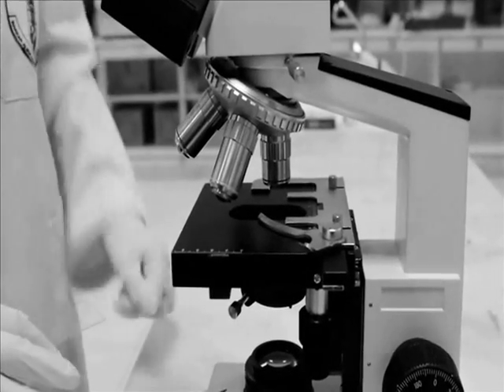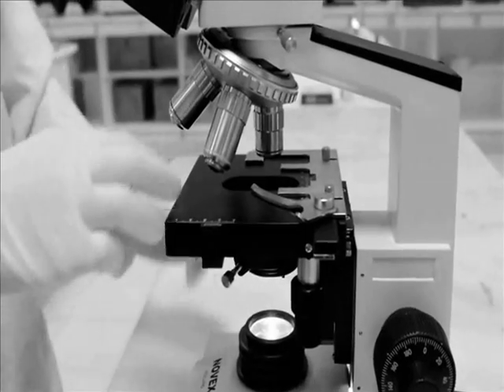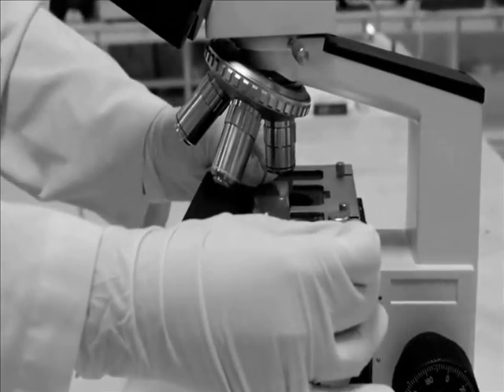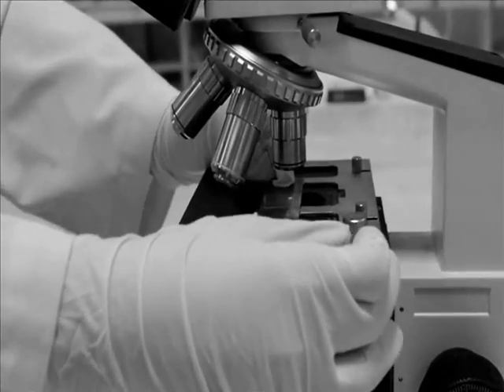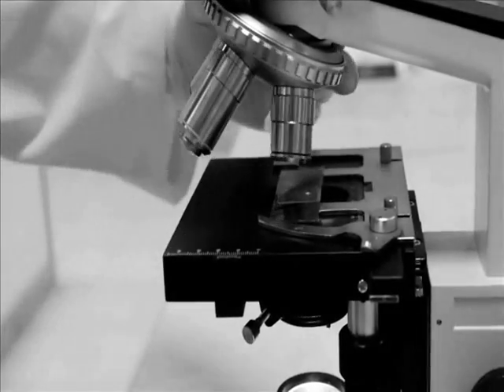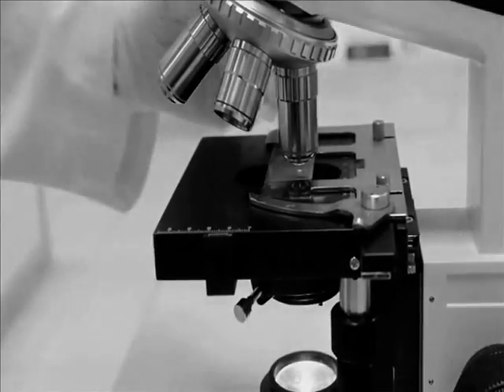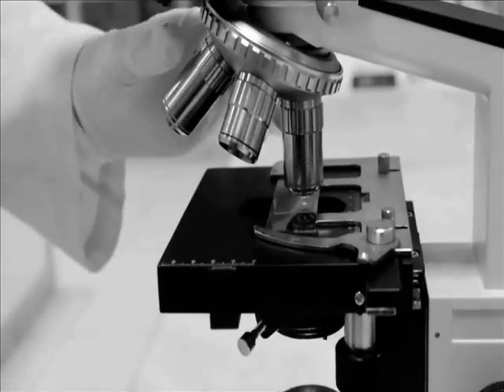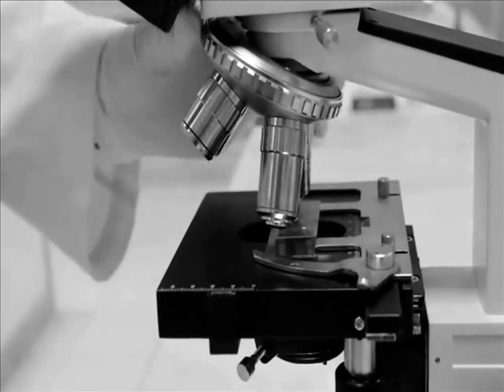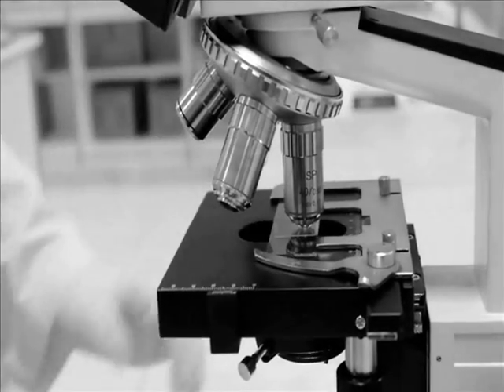Next, see the slide under the microscope. To see egg and larvae, use Power 10. And use Power 40 to see protozoa cysts and trophozoites.